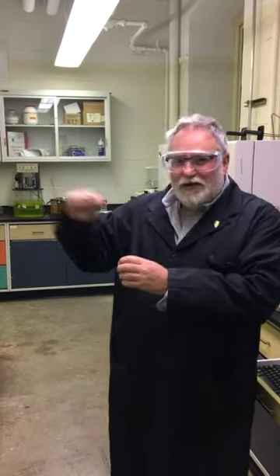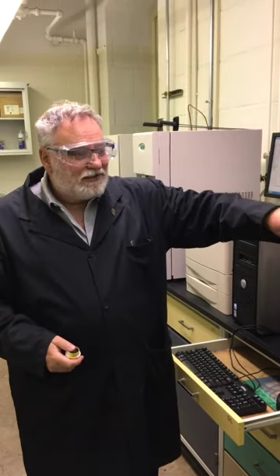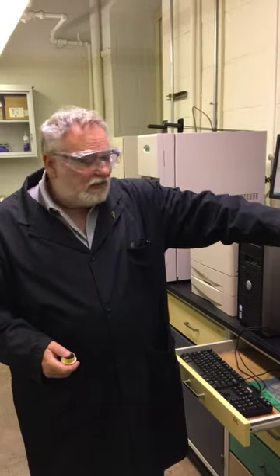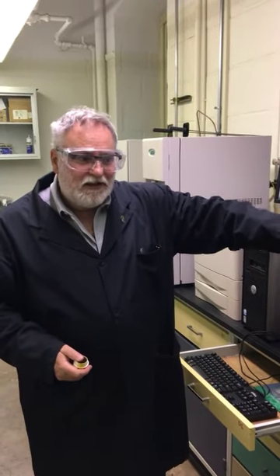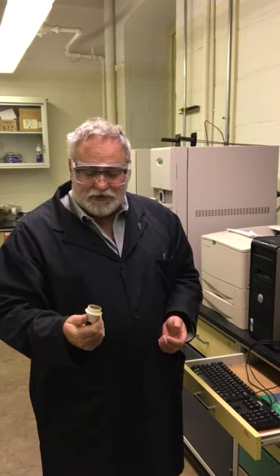We don't need that precision here because we're just loading in approximately 1 gram, but the instrument needs that level of precision. Precision relates to the decimal places and the uncertainty in the data. The accuracy relates to whether that data is right. Because coal is highly variable, we're going to do at least triplicate analysis for all of these components.